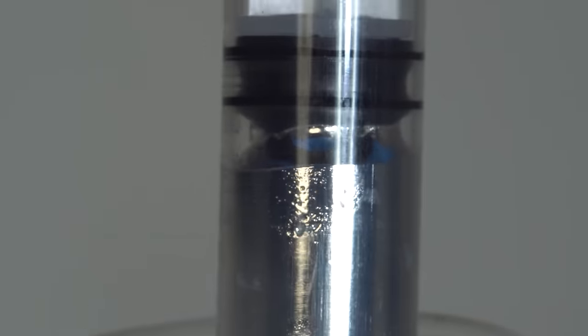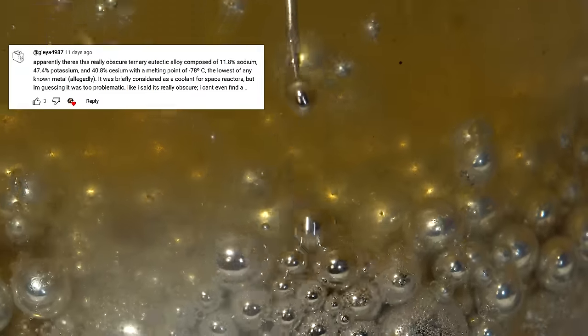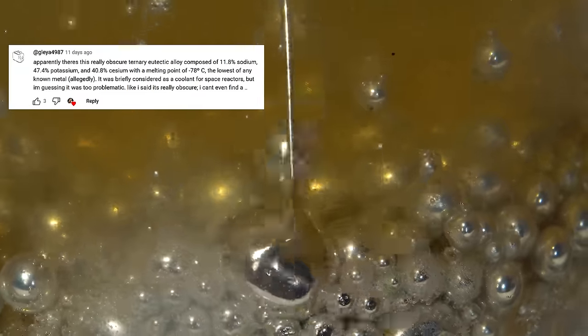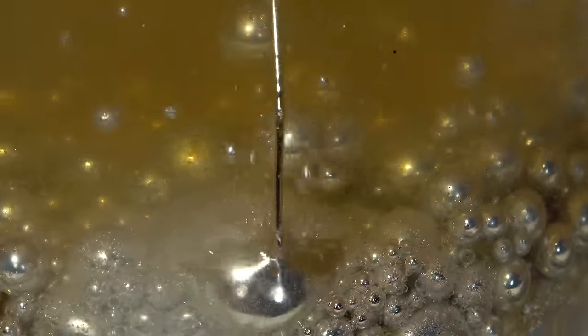However, with a ratio of 40% cesium, 48% potassium and 12% sodium, the result is a liquid that freezes at a record low temperature of minus 78 degrees Celsius.